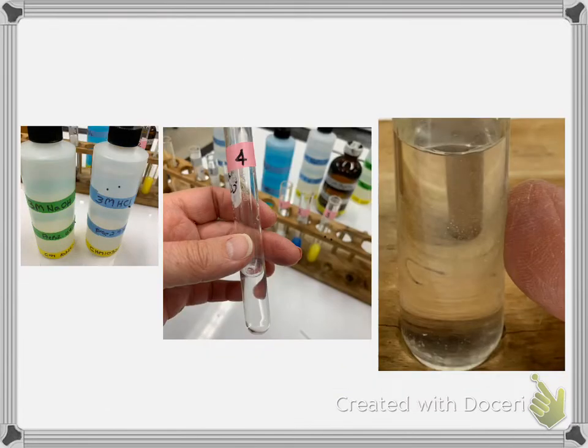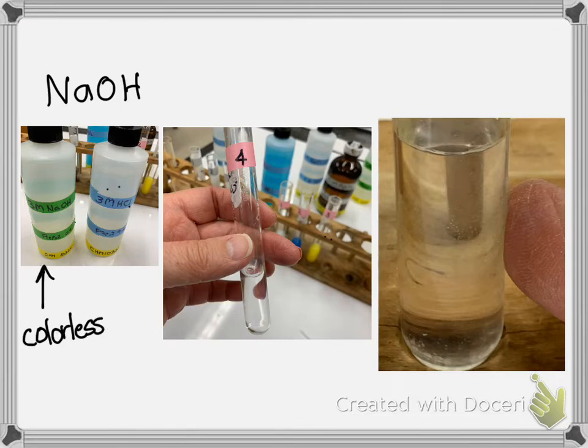And then finally we added sodium hydroxide, which you can see here is clear. There's no particles in it, and it's also colorless. And hydrochloric acid, which is also colorless.